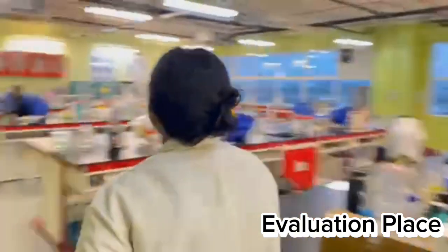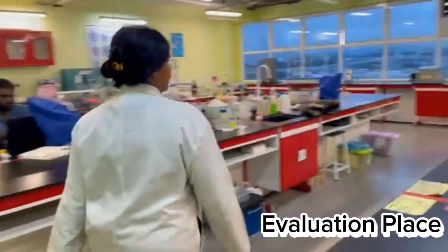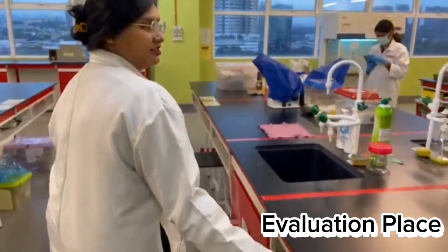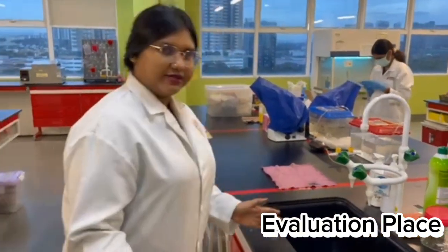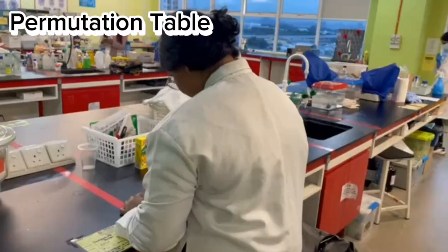Hi, now let's take a look at where the panelists will be seated. The panelists will be seated here. This is the sink for them to spit or to clean their palate. This is the place where they will be seated. Now let's go to the preparation area.